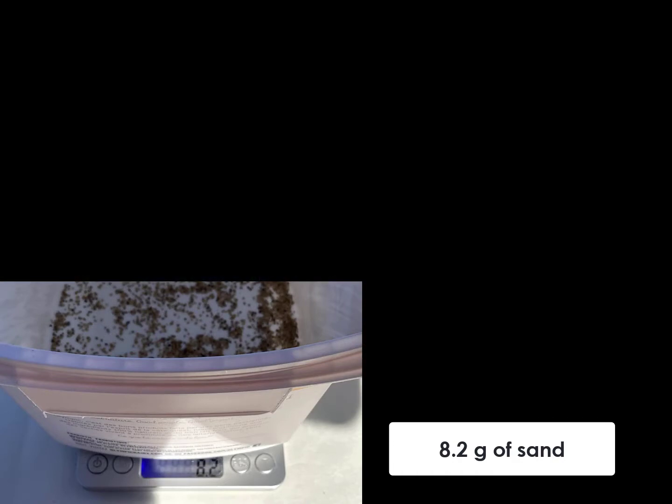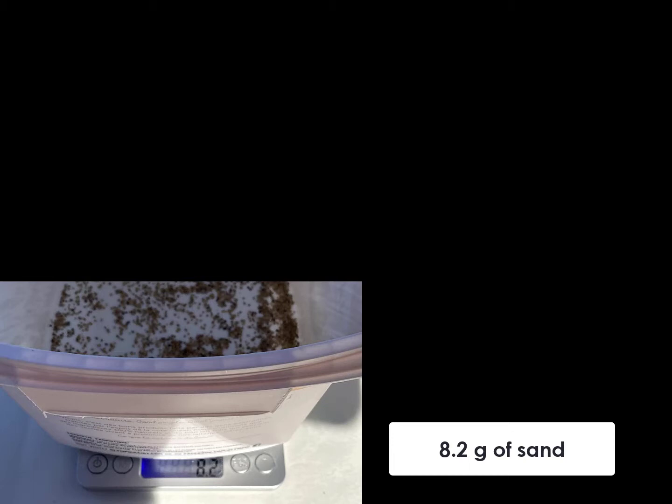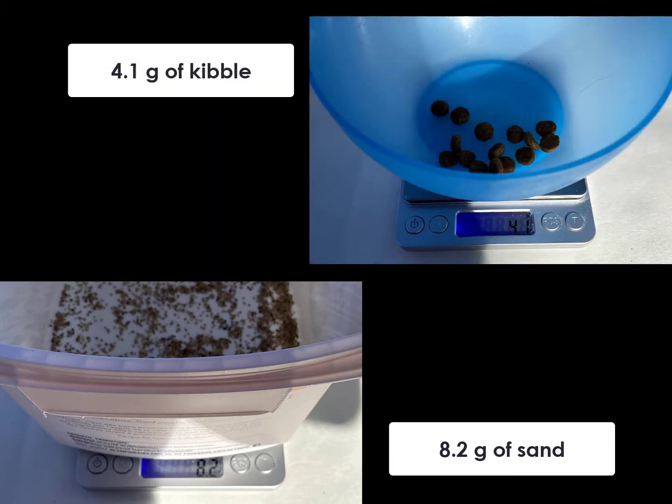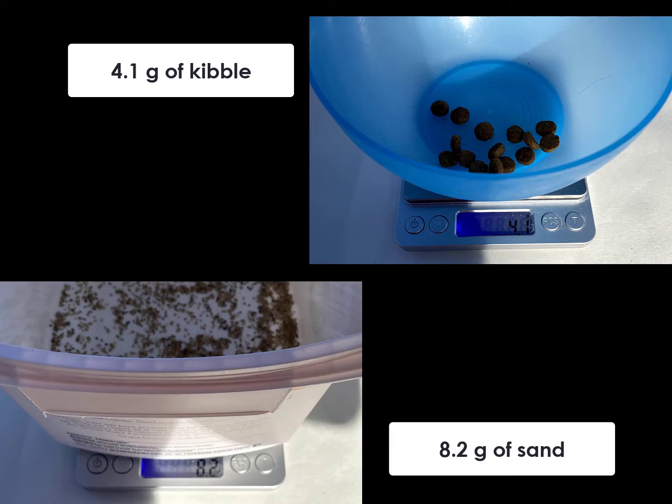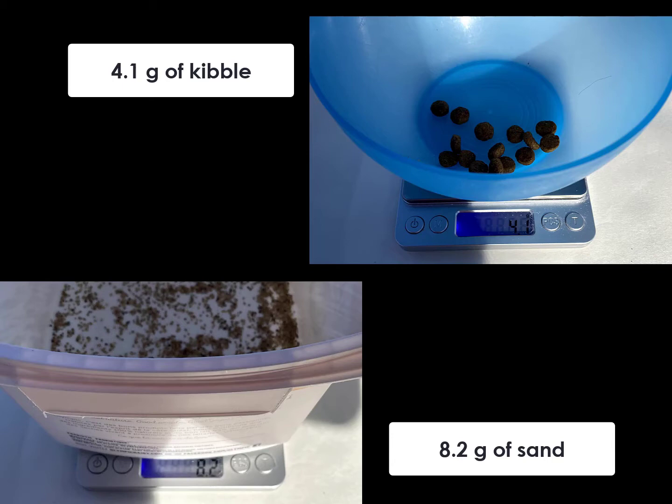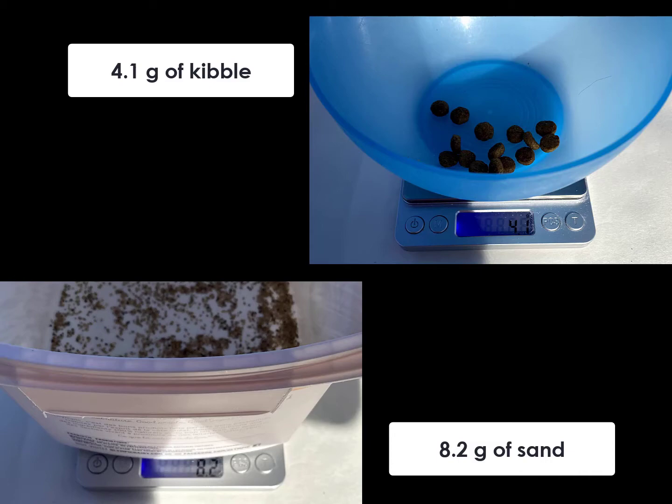Just to check, let's transfer the kibble to another tared container and check its weight: 4.1g. So the total weight is 12.3g. We do have 0.3g of material that's unaccounted for, but this error is on the order of about 2% — much smaller than the bias introduced by our sampling scoop. The small error is easily explained by being outside with an occasional breeze, or by having a cheap $20 balance.